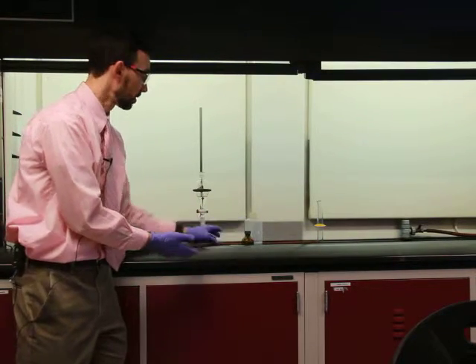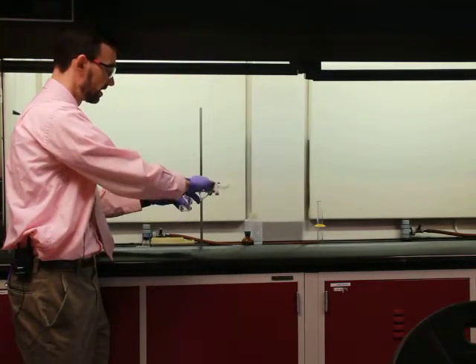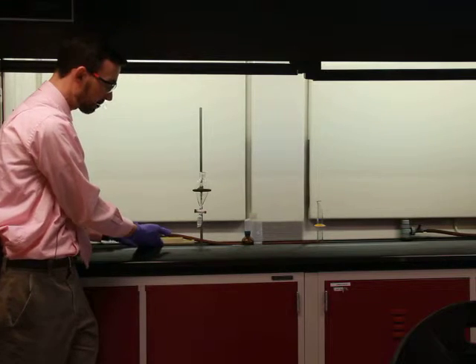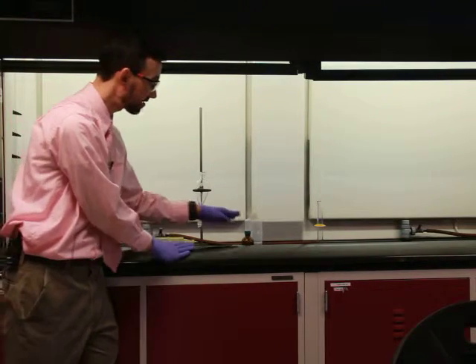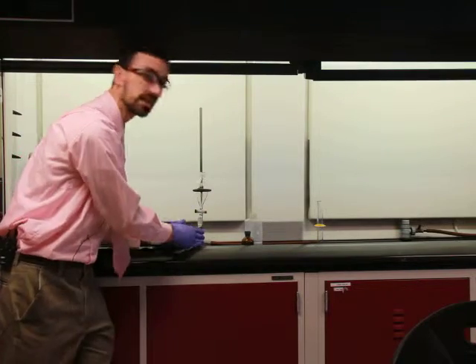All right. So I put my water into one, and then I would pour back out my ether fraction into another. So at this point, I should essentially have neutral compound here in ether, because it stayed in ether. And I should have my acidic compound over here in the base. But something happened when I put it into the base.